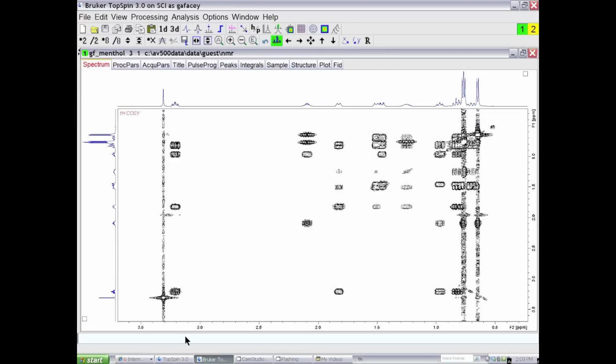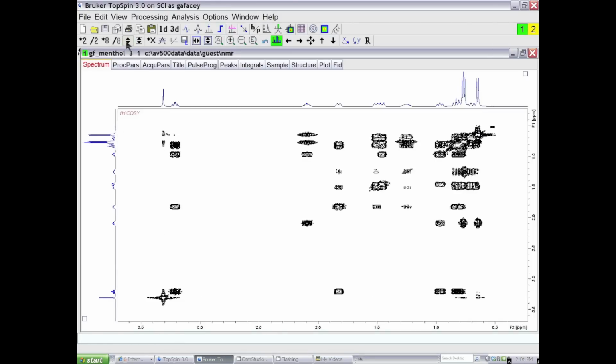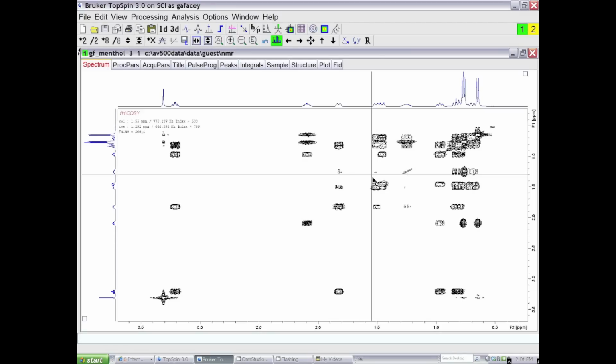Now I'm going to symmetrize the spectrum. It's symmetrized with the command SYM, and then enter. And then I'm going to scale the data set again such that the same response is just on scale. So now this off-diagonal response is just on scale, and we can see that we've effectively gotten rid of all of the stripes of T1 noise.